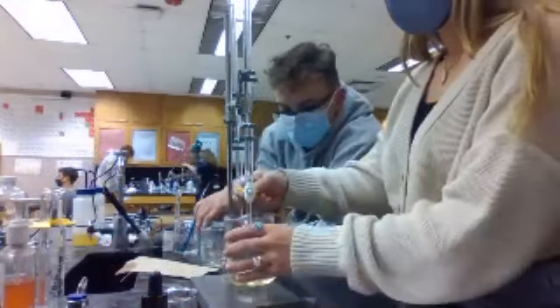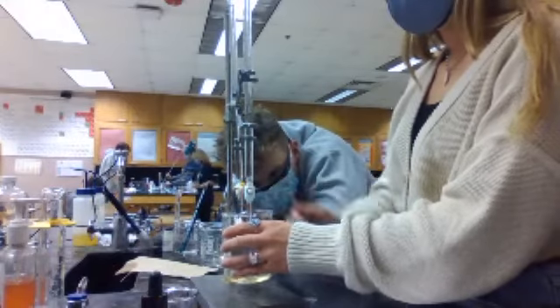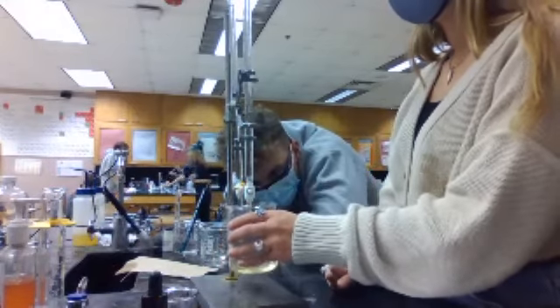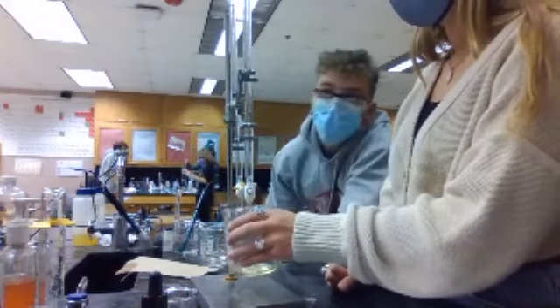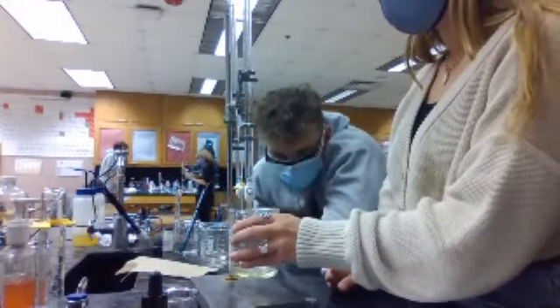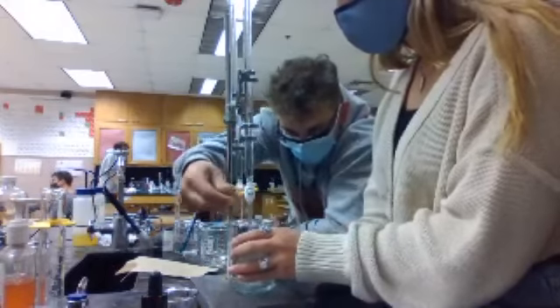So if it took 9.99 last time, we should be almost to 20 by the time this test goes. Let's keep going. 9.99 times 2. The answer is 19.98. So I'm thinking 19.98, depending on how good the first trial was. Get ready. Yep, stop. There we go.